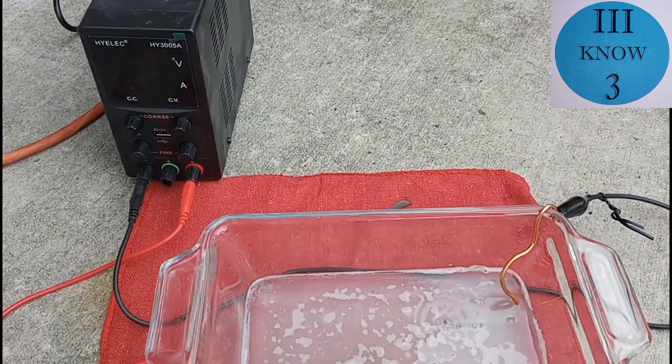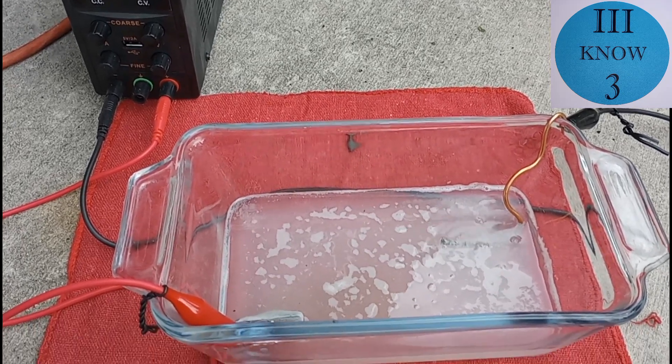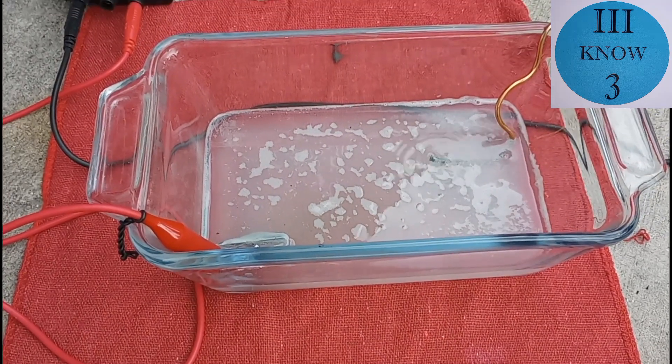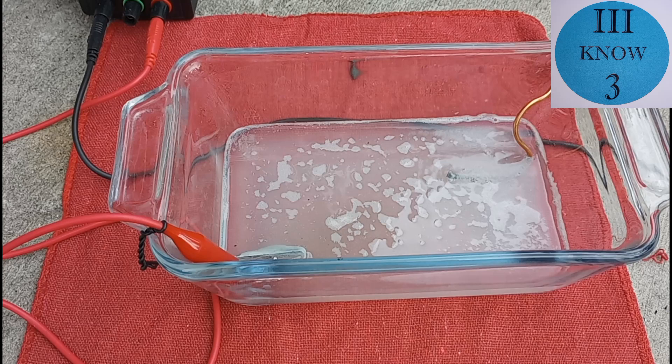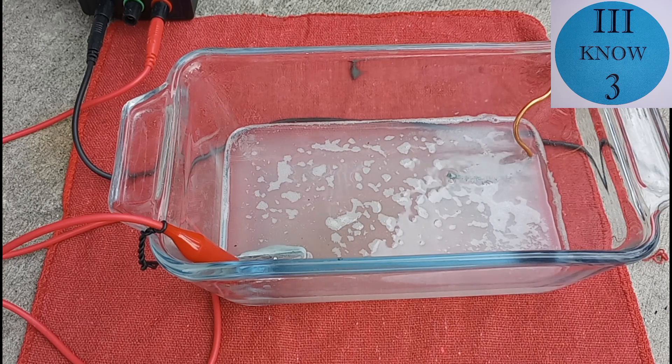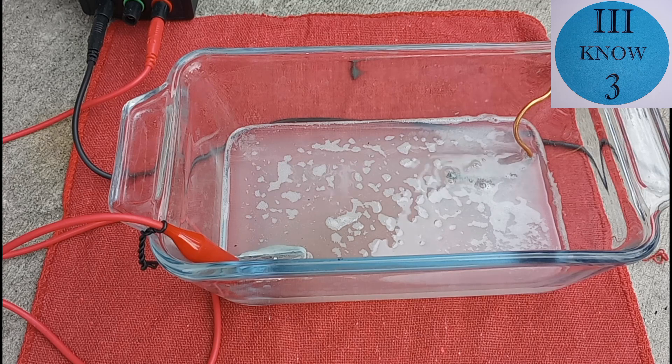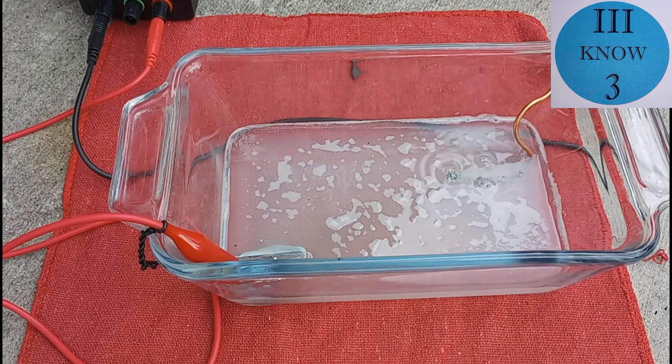Honestly, at this point, I really don't know what to expect, but I'm pretty sure that my stannous chloride solution is not that pure. So I'm not really expecting great tin crystal growth right from the start. If you watched my tin melting video, you know that the source of the tin was from some guy off eBay and he only claimed the tin to be 96% pure. So all I have is his word that it is 96% pure.